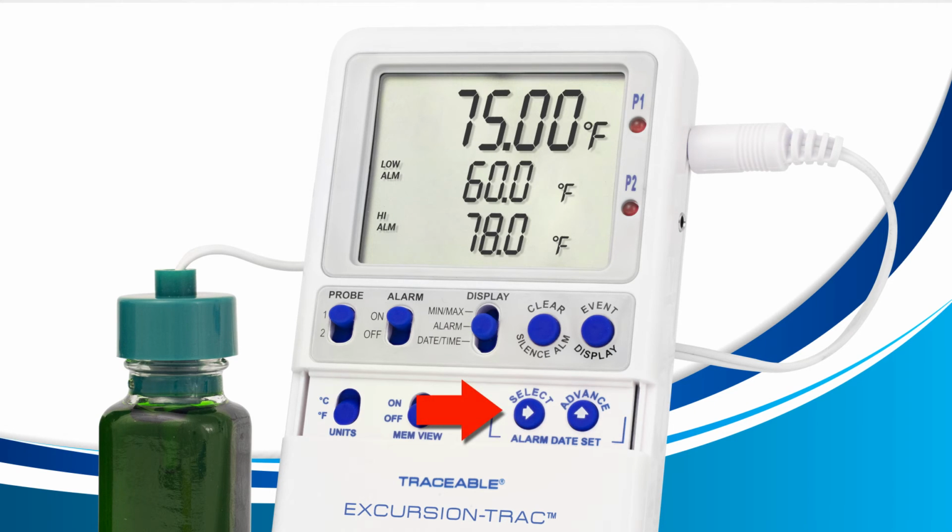The select button allows you to select fields on your LCD that you'd like to change. Each press will move the flashing field to the next area. If a number field is flashing, each press of the advanced button will increase the value by 1. If the words low alarm or high alarm are flashing, pressing the advanced button here will change the values between negative and positive. Now that you know what the select and advanced buttons do, use them both to set your desired low alarm and high alarm.